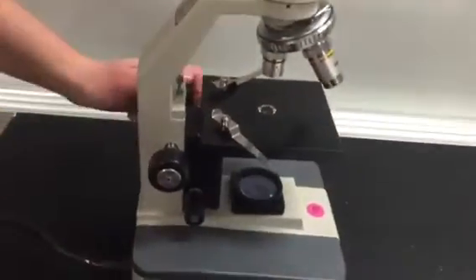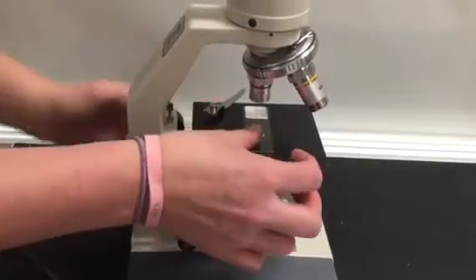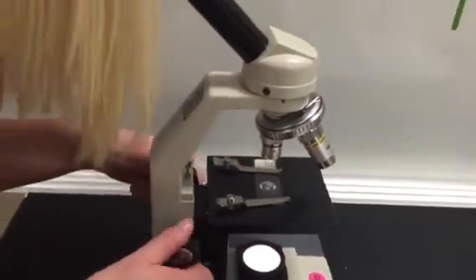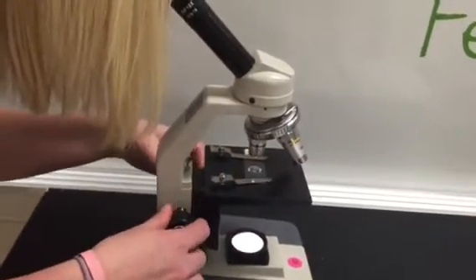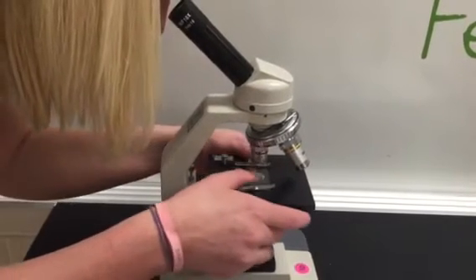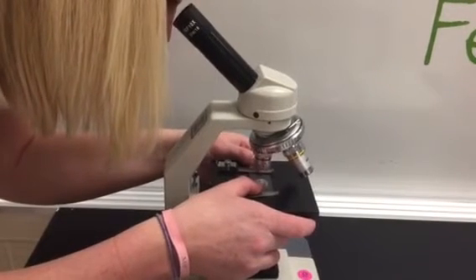So I'm going to start with this paramecium. I'm going to make sure that my microscope is ready. I'm on low power and my stage is completely lowered. Turn on my light and I'm going to get started. Put my eye to the eyepiece, move the coarse adjuster toward me until something comes into view, until I say, whoa, wow, that's cool. If I do not say whoa, remember, I don't see it.